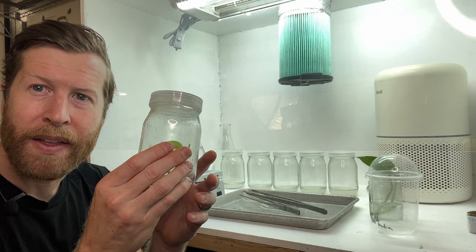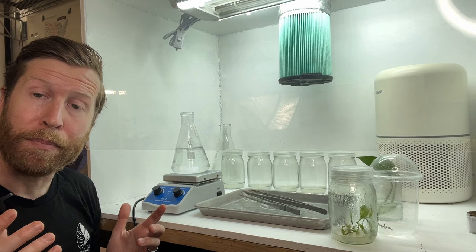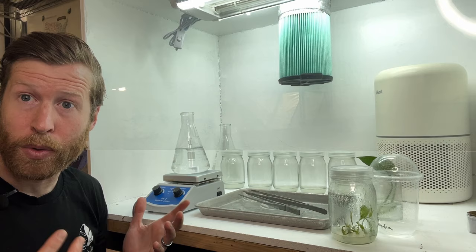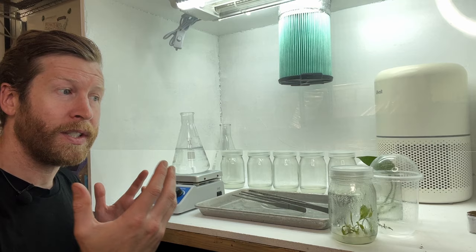Here is a jar of Thai constellations that are about two weeks old and are beginning the multiplication process. Here we have a magnetic stirrer spinning a 10% bleach and water solution, always using distilled water, to sterilize the plantlet we're going to be putting into the multiplication media. Tissue culture is all about being sterile — from the air, to your hands, to all of the different tools and utensils you're using. We also have a small alcohol torch, which we use to sterilize our metal and glass utensils. In the back corner, we also have a HEPA filter in case any pathogens enter the laminar flow hood during our work.